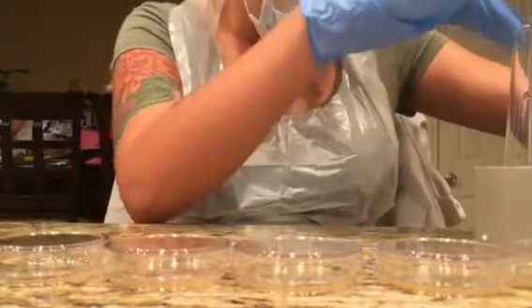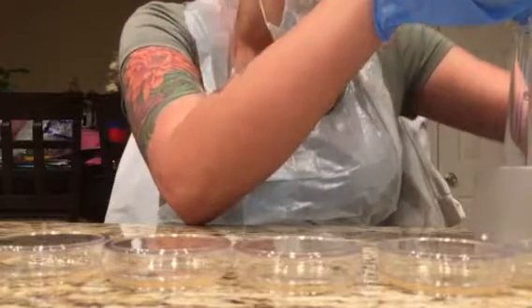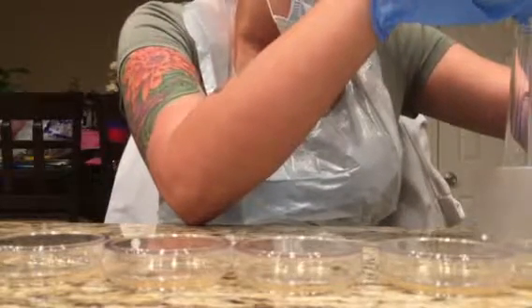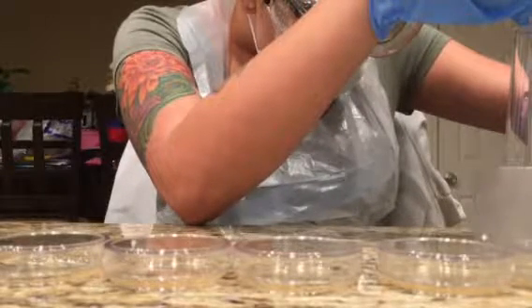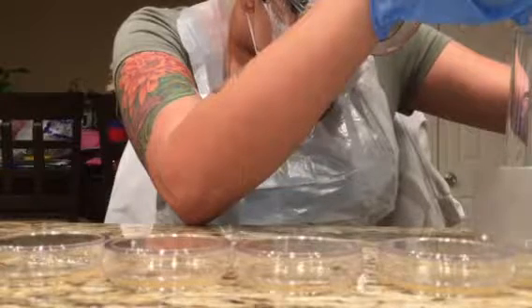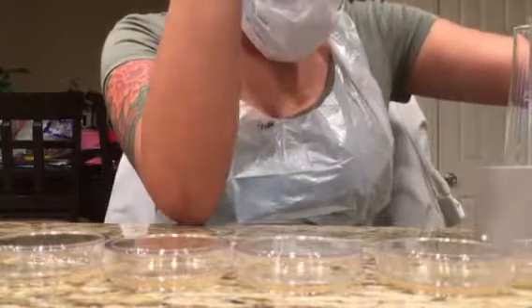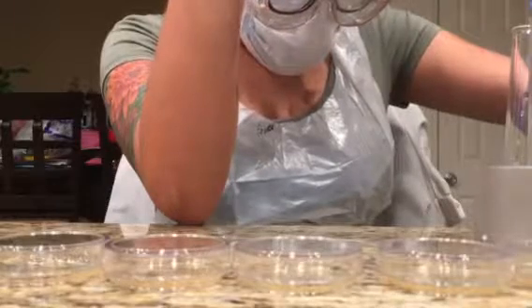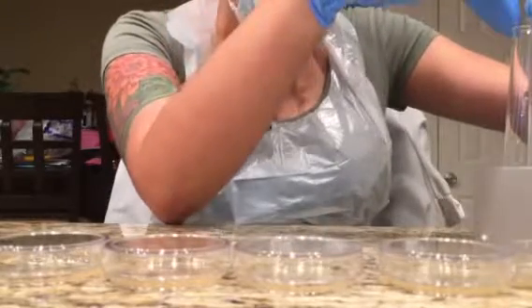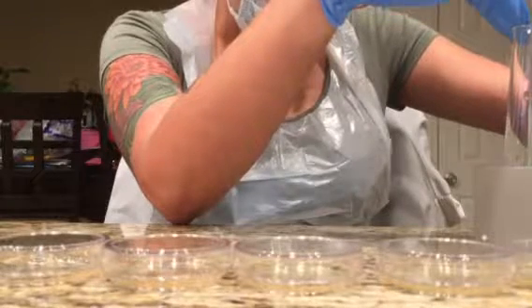So I have my first sample. Let me see where the line is at. Okay. Sorry for the noise in the background. Okay, so here's 0.25 of the first solution. I will then drop it into the second solution. Again, swish it up and down to ensure that it is all mixed correctly.